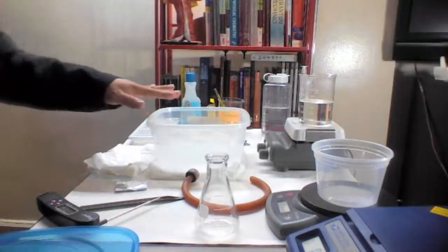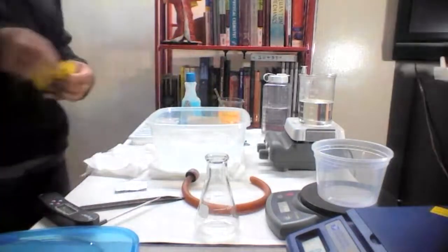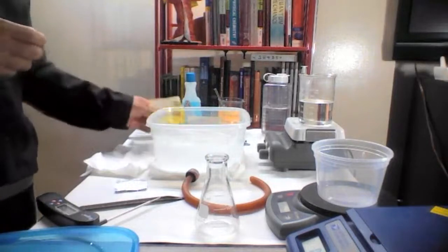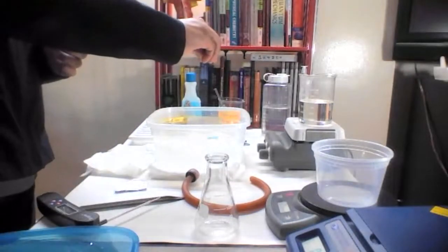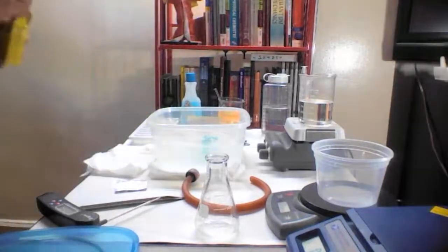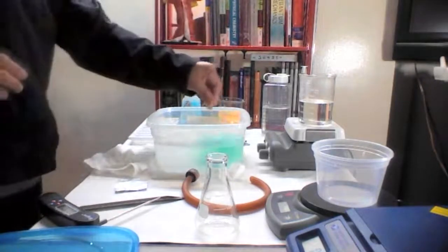I see that the water is not very visible on the screen, so we're going to pull a bag of tricks here, and okay, we're going to give some color to the water, to make sure we can see it. Okay, so now the water has some color, and it will be visible in the camera.